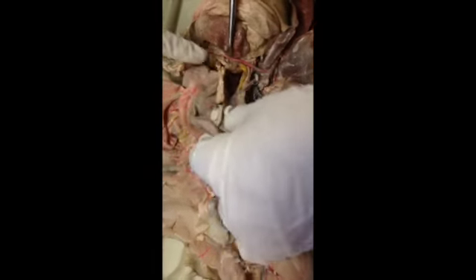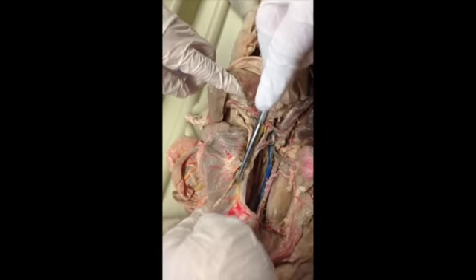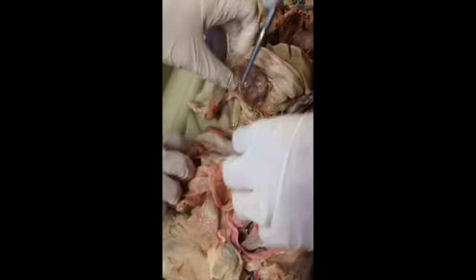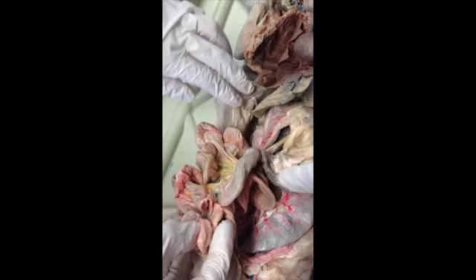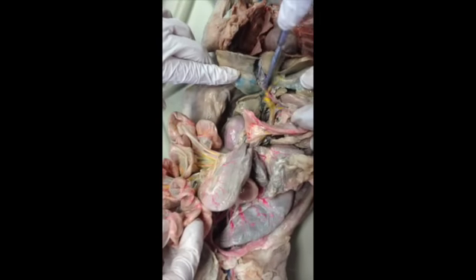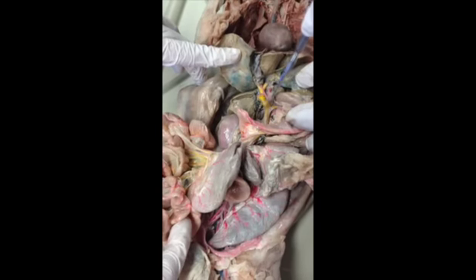Okay. Let's not forget, what is that? The yellow is the hepatic portal. You can see how it's coming from the colon, it's coming from the small intestines, and it's going into our liver. It's a really good spot over here. So we've got different lobes of the liver, and we've got different parts of this hepatic portal vein that's going into the liver.